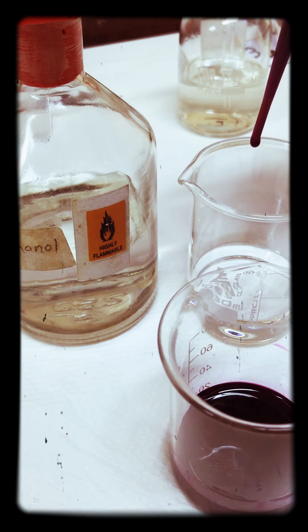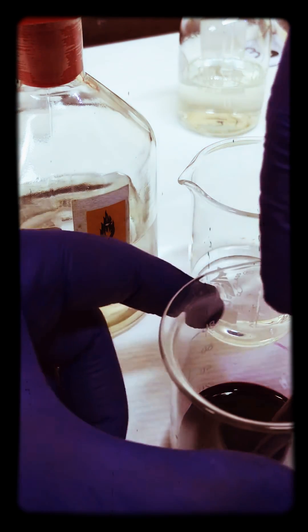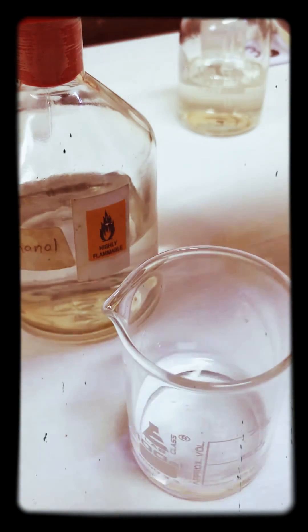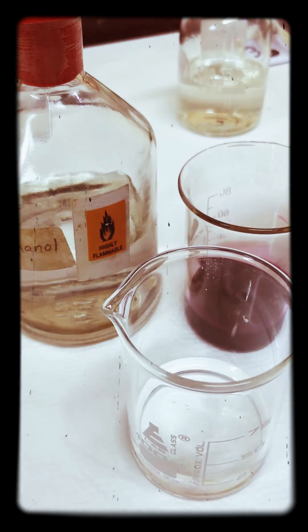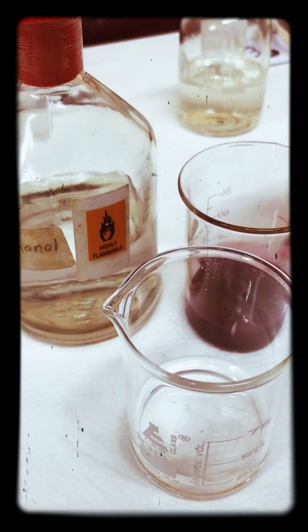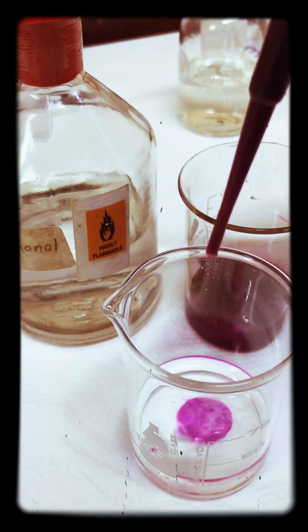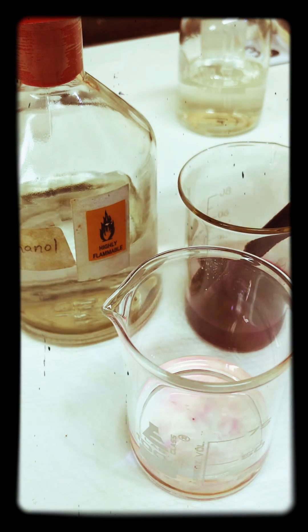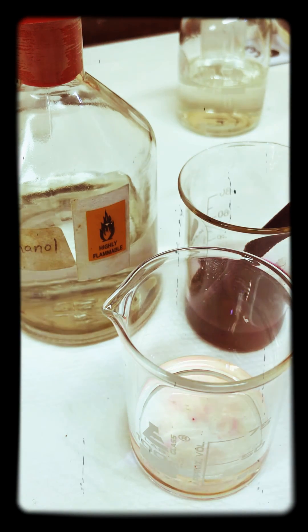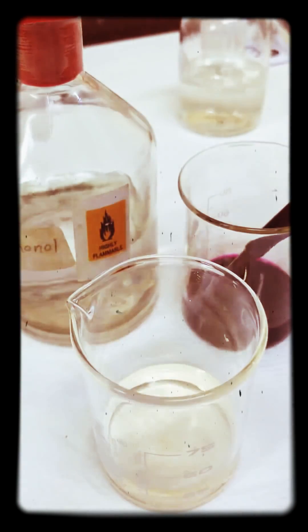And what you'll notice is that the ethanol — I'll just swap this around so you can see it — the ethanol doesn't turn purple when you add the potassium manganate. The colour just decolourises.